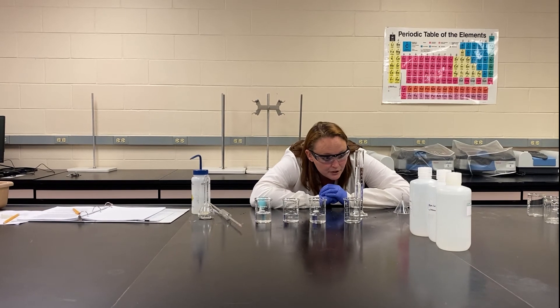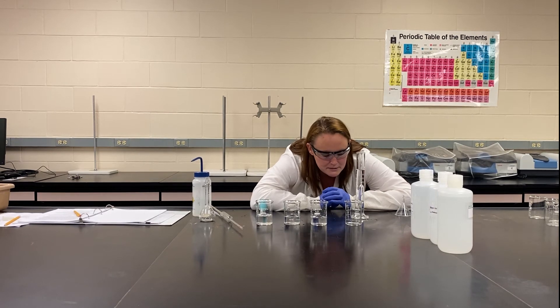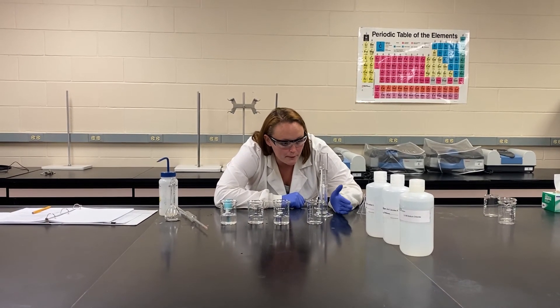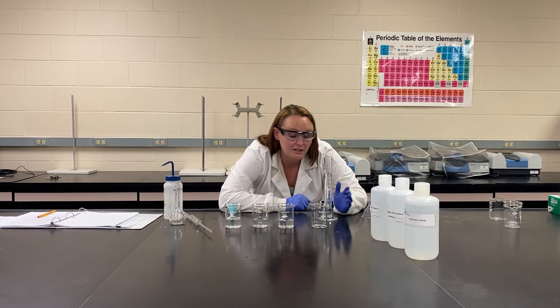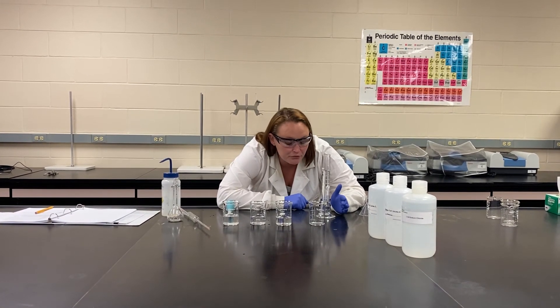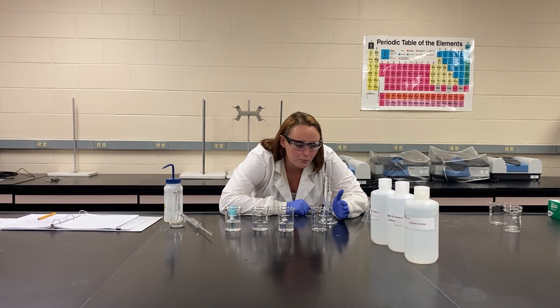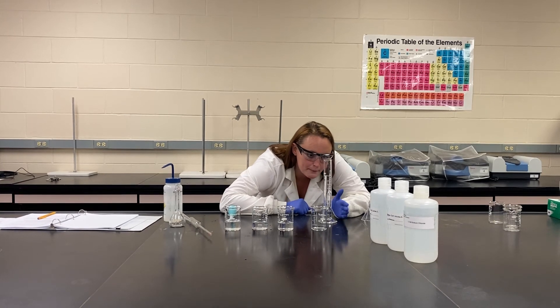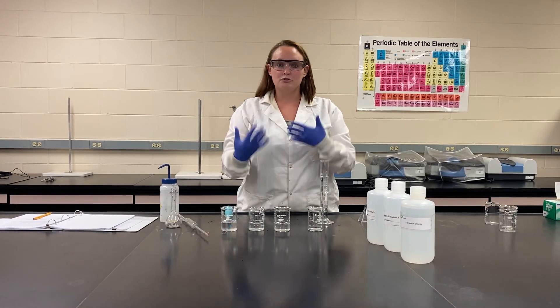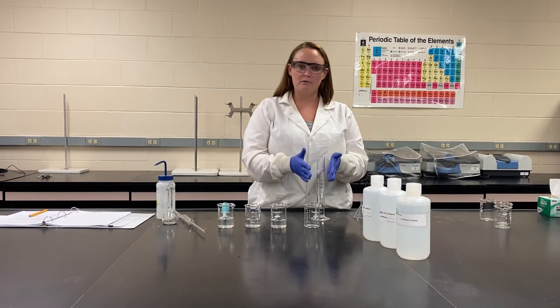On this you're going to read between two numbers. A hydrometer reads to four decimal places. Our numbers are between 1.000 and 1.010, and there are 10 tick marks between those numbers. So we are between 1.0050 and 1.0060, and we're roughly at 1.0055. Again, you'll join with another group and measure your 0.25, 0.5, and 1 molar solutions the same way we did this one.